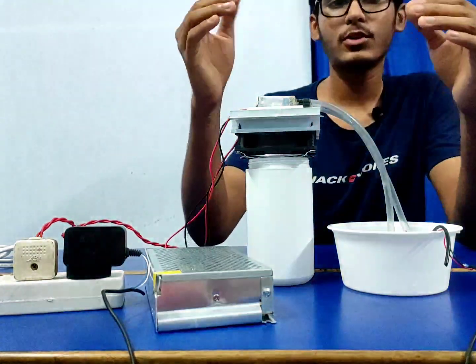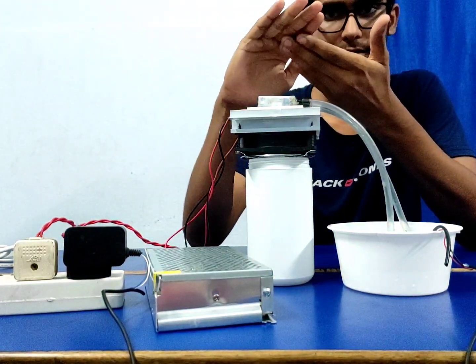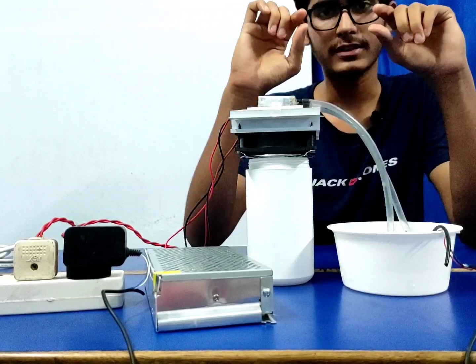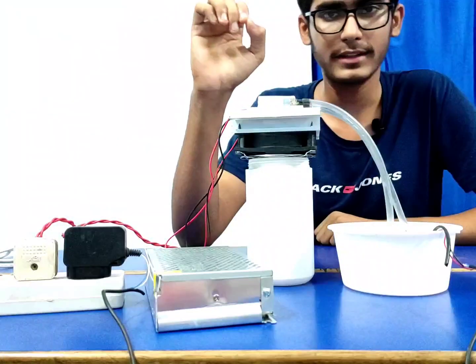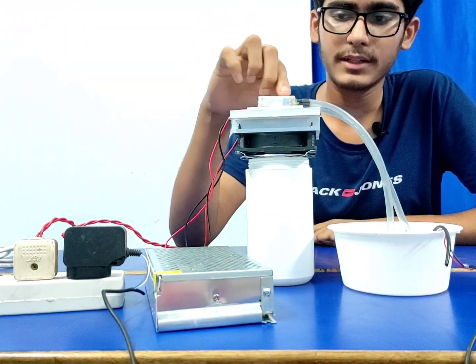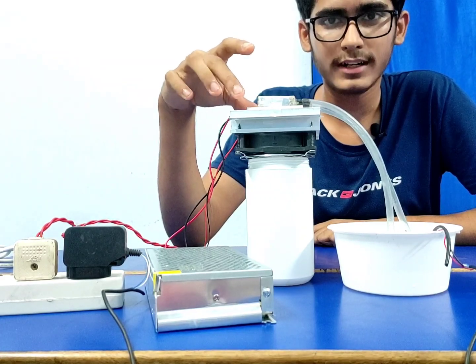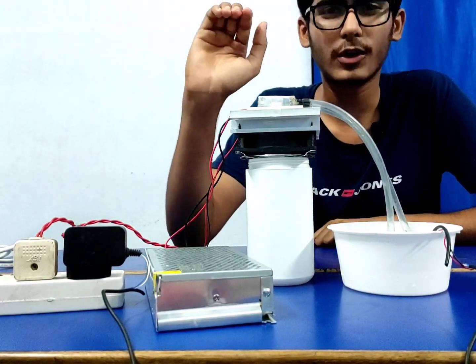The idea is, if we cool the hot side down, then the upper side of the Peltier, which gets cold, will get even colder, because the Peltier will create that difference. If it's getting hot up to 50 degrees, and if we take an example that the Peltier is doing a 20 degree gap, then the upper side temperature will be 30 degrees. But if we can cool it down to nearly 30, that's not very practical. Yeah, we can say up to 40 at least.